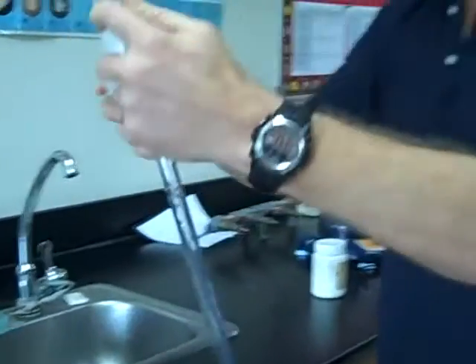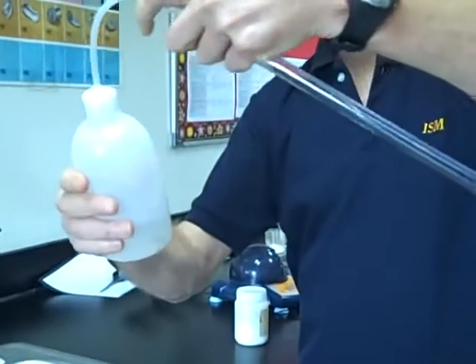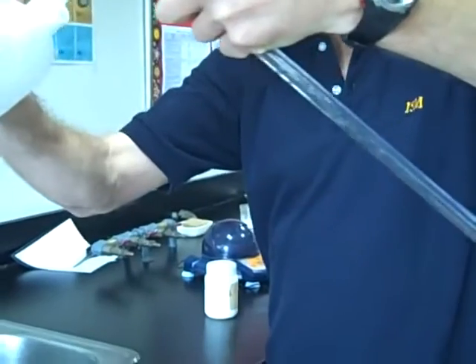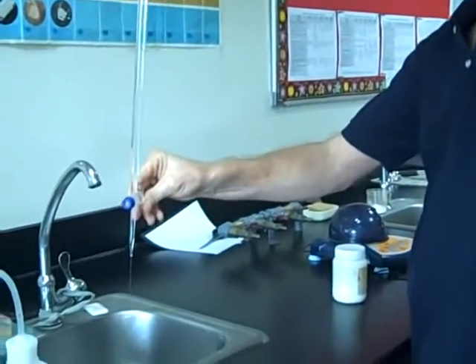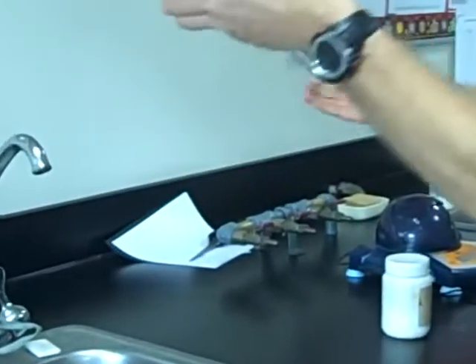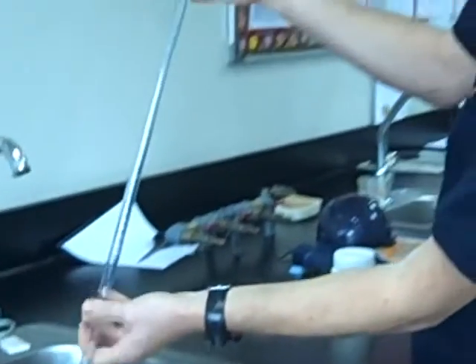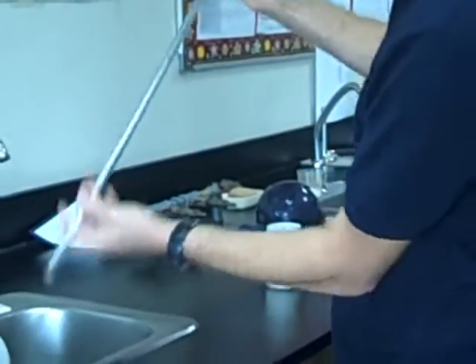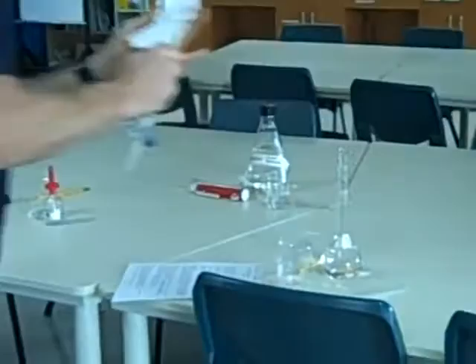I'm then going to do the same with some distilled water, making sure that it goes through the tip and that I swirl it out, touching all sides and opening the tap at the same time. Give that a little shake. Close the tap. Dry the outside if needed.